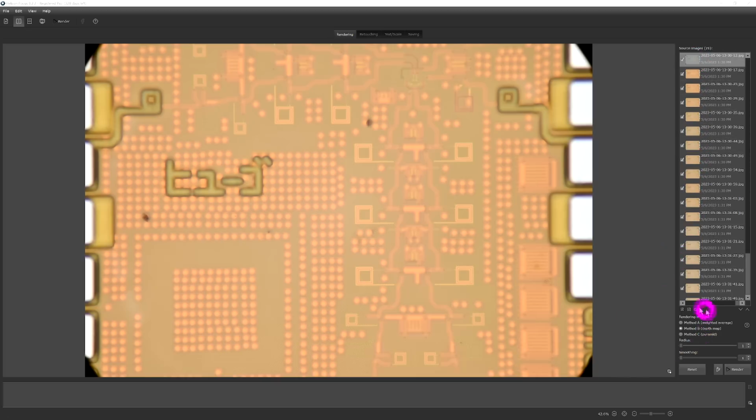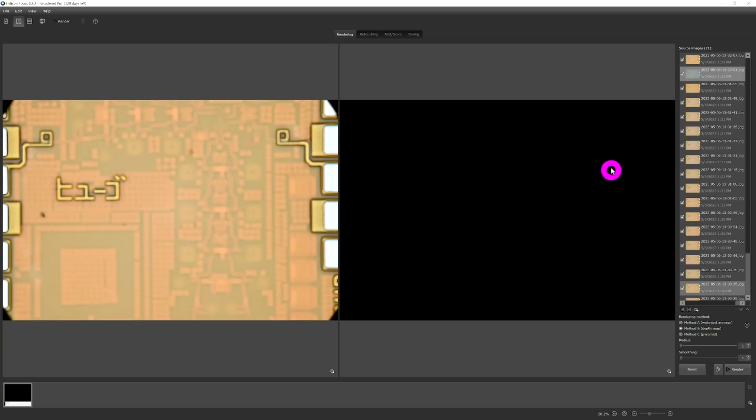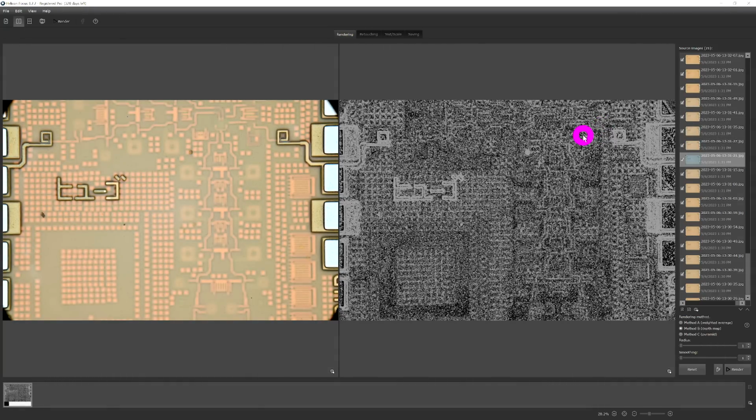I have put all of the 21 images we've captured. I'm playing around with some of the settings, but this is just the highest amount of computation that I'm throwing at it that I know how to do at the moment. So if you go render, it's going to go through all the images. First it goes through them in one direction, trying to figure out where the images are in focus.